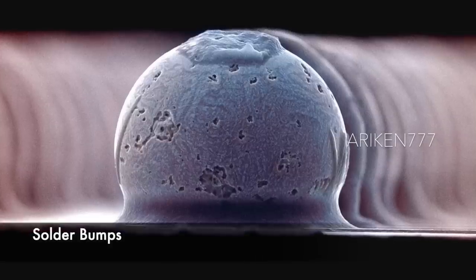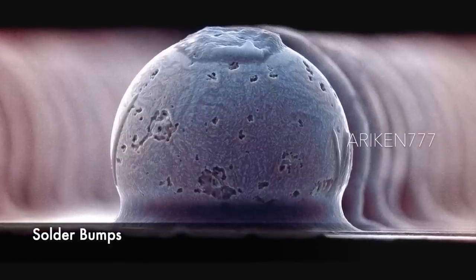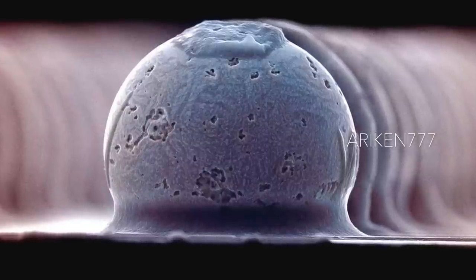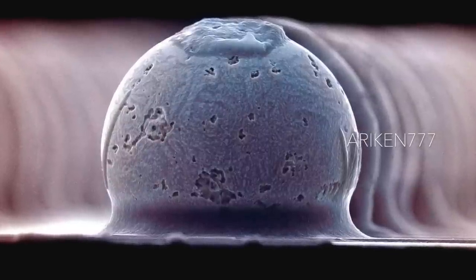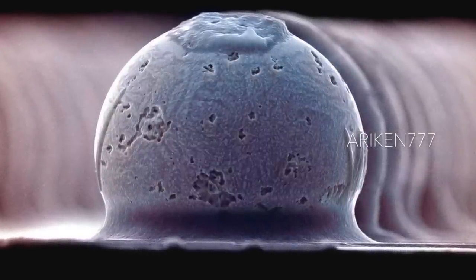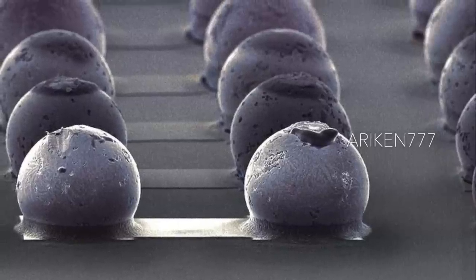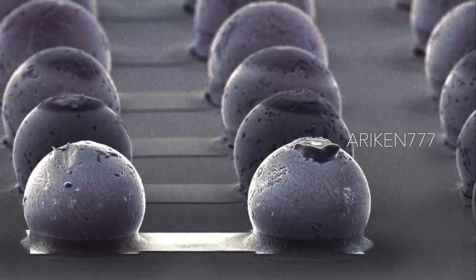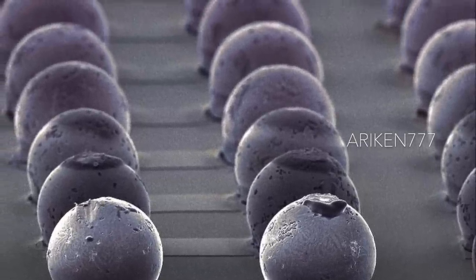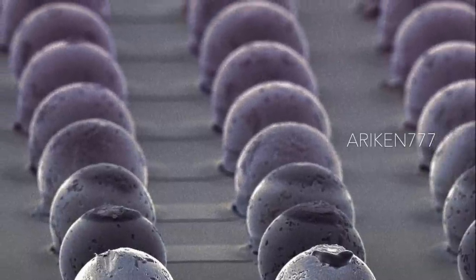These are rows of solder bumps on a substrate. Solder is a metal alloy that is melted to join metallic surfaces, a process known as soldering. The type of alloy used depends on the metals that are to be joined. Alloys with low melting temperatures are known as soft solders, and those with high melting temperatures are known as hard solders.